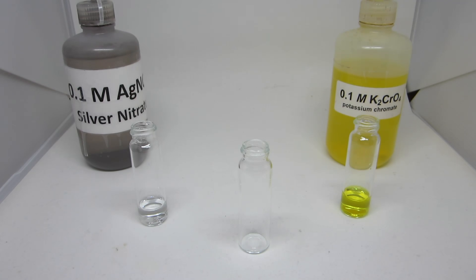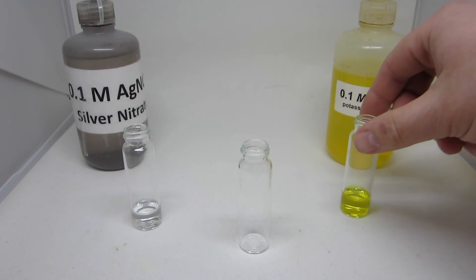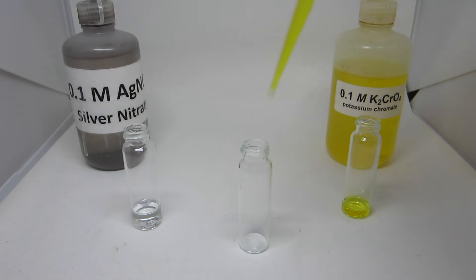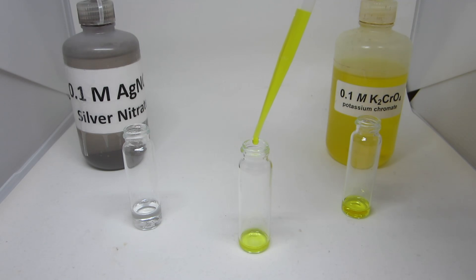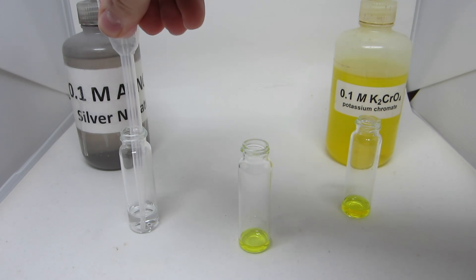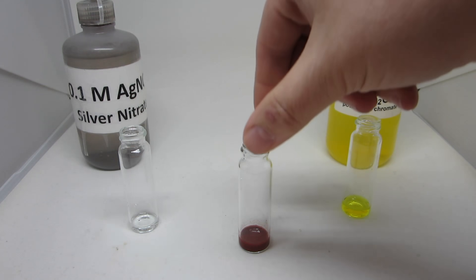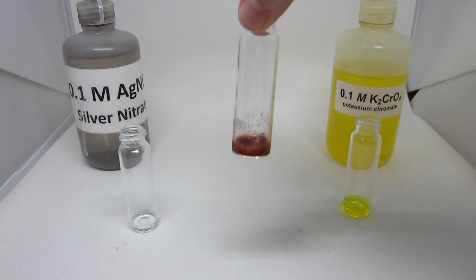The second reaction looks at the combination of silver nitrate solution and potassium chromate. We can take 10 drops of potassium chromate and react this with 10 drops of the silver nitrate. Notice the deep red color of the product, silver chromate.